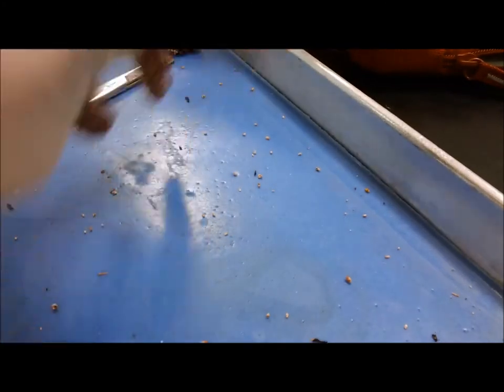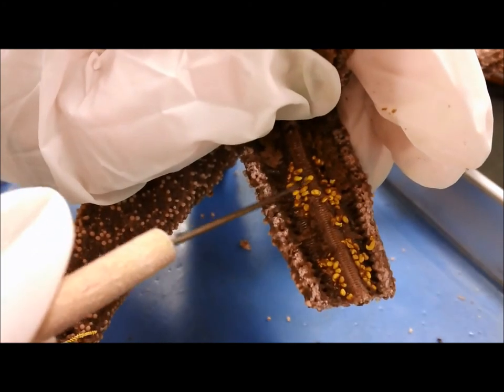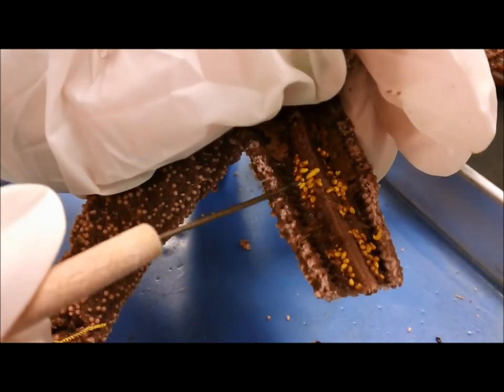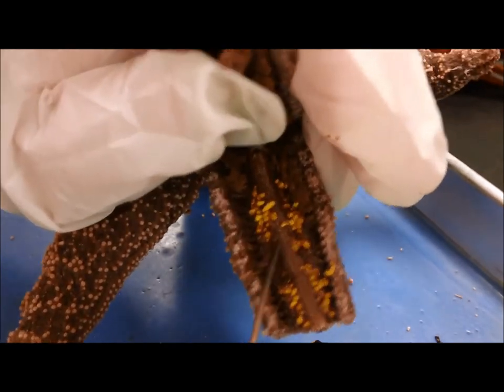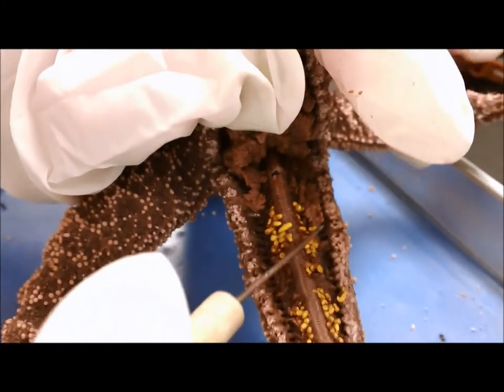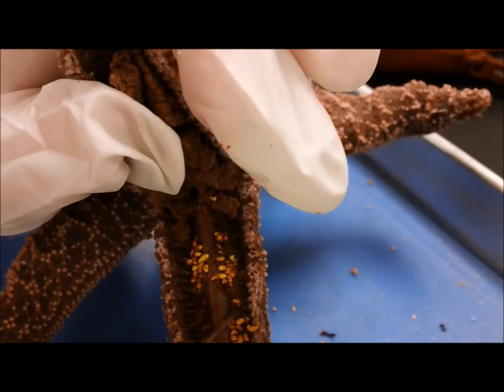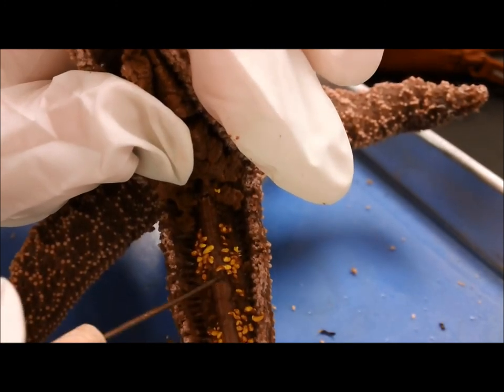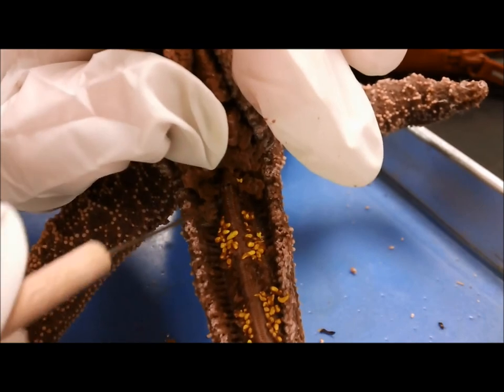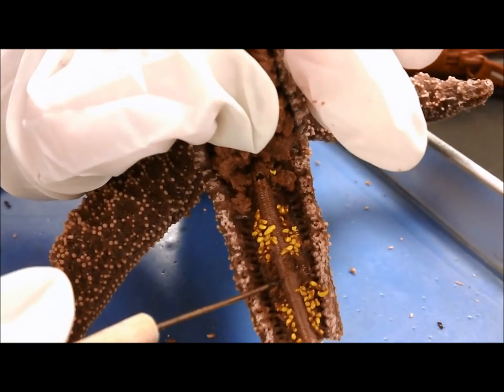Now on this side of the arm, what you're looking at here are parts of the water vascular system. This is the other side of the tube foot basically — these little things are called ampulla. And then you can see this kind of moistness here. There are the gonads — it's like a glandular thing right here, kind of in the midst of all these ampulla. I can scrape some of it off right there next to the radial canal. Those are the gonads — that's where you're going to be making your eggs and sperm, if you're a starfish.